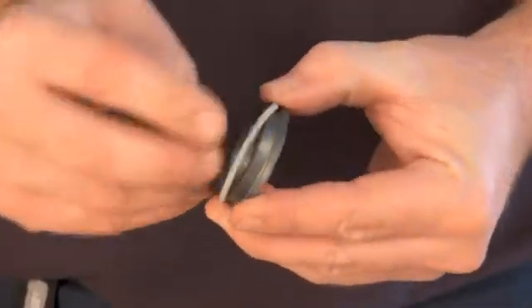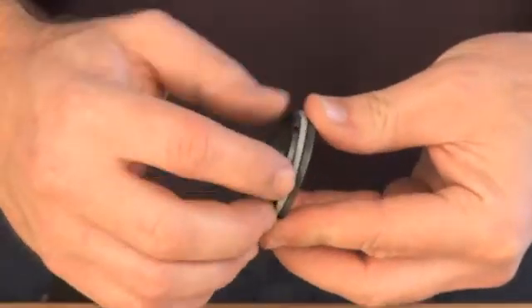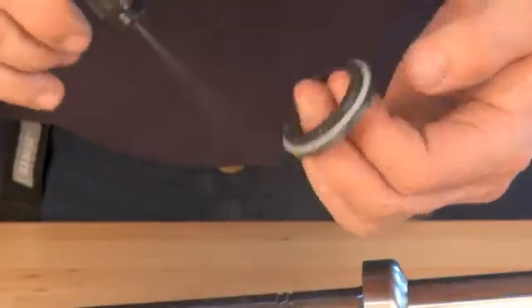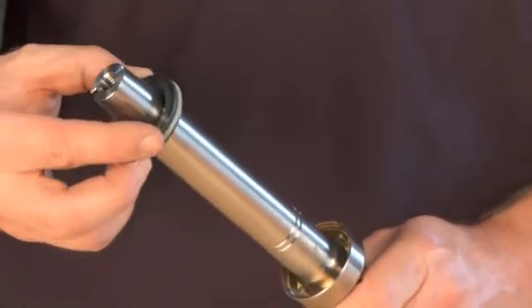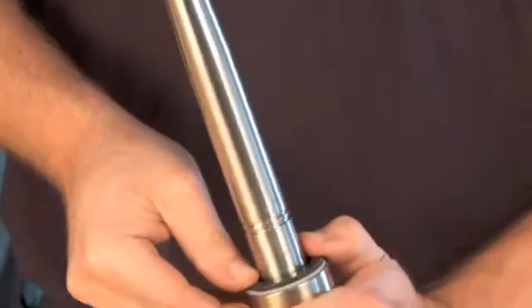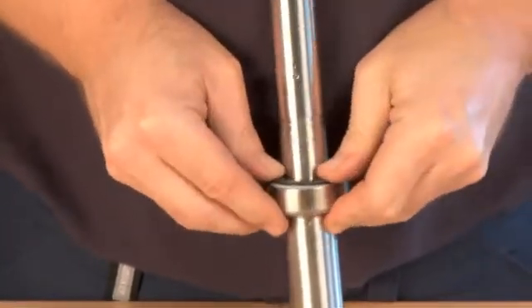Mount the O-ring on the rotating part of the seal. Lubricate with water to make it slide easily into place. Place the rotating part of the seal in the counter ring. Check that the pins are in the proper position. Gently press the seal part into place.